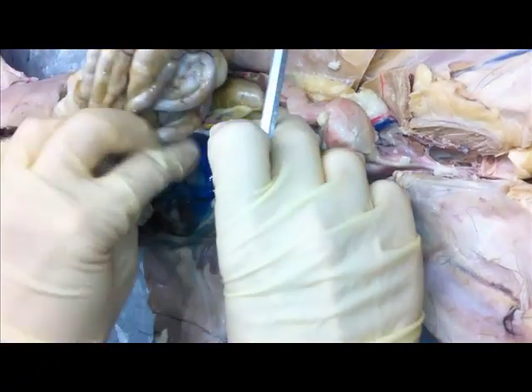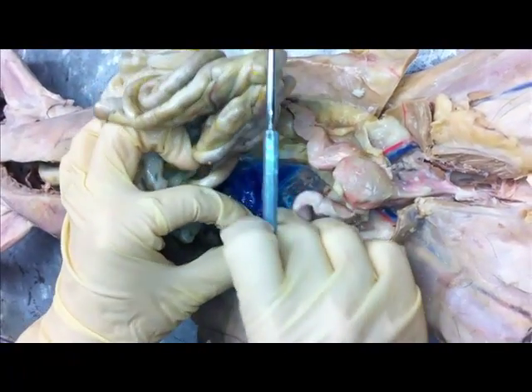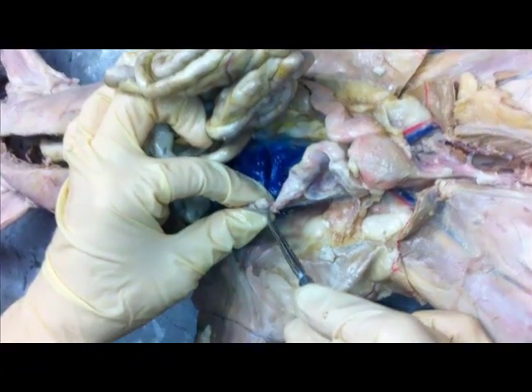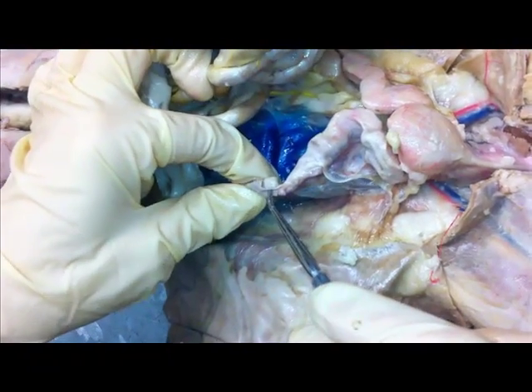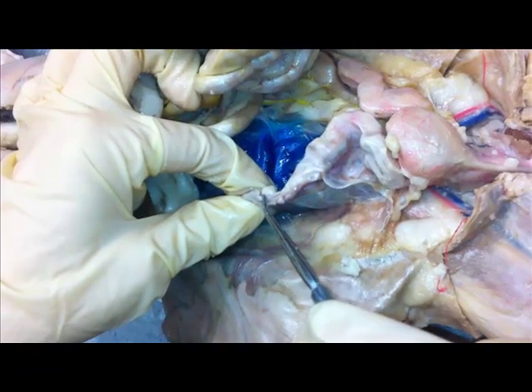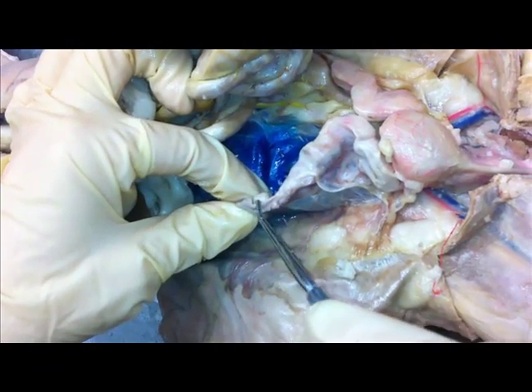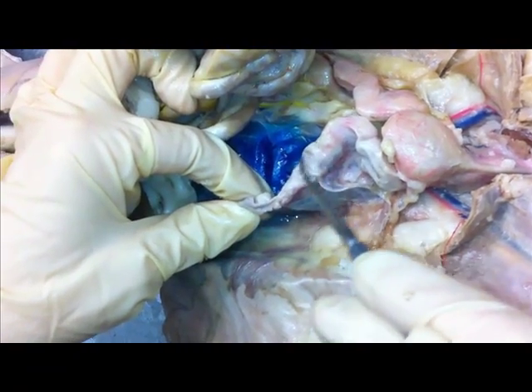If we go all the way out, we'll find another ovary right here. The oviduct is right there — that tiny little thing is the oviduct. See how it's going towards the uterine horn?